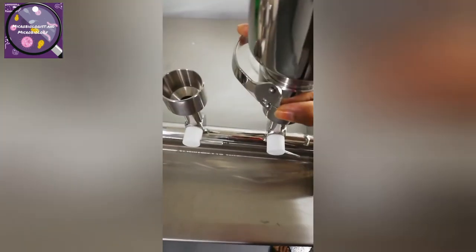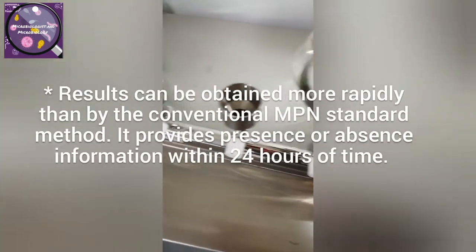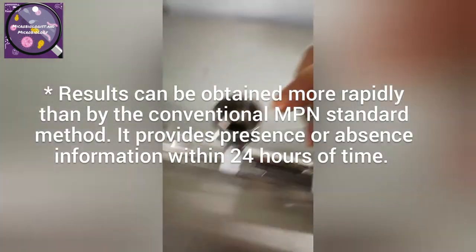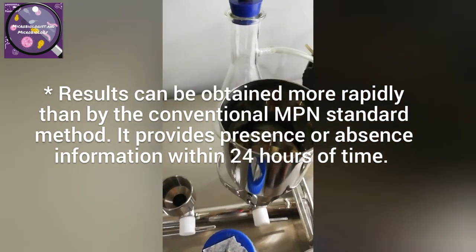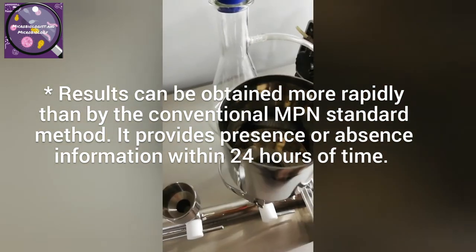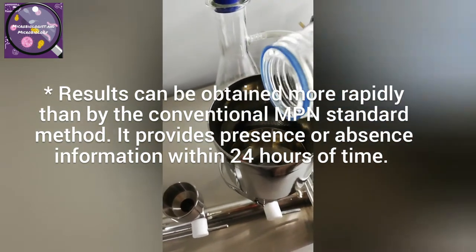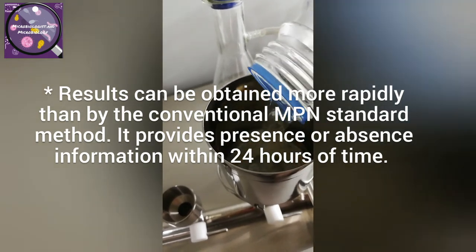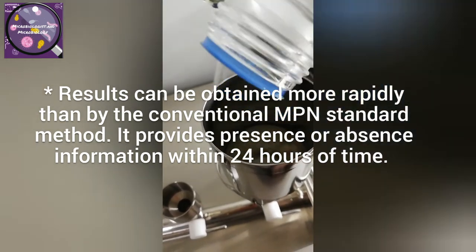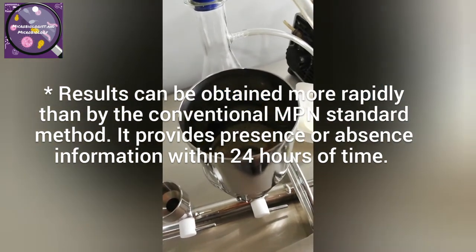Results can be obtained more rapidly than by the conventional MPN standard method. It provides presence and absence information within 24 hours.